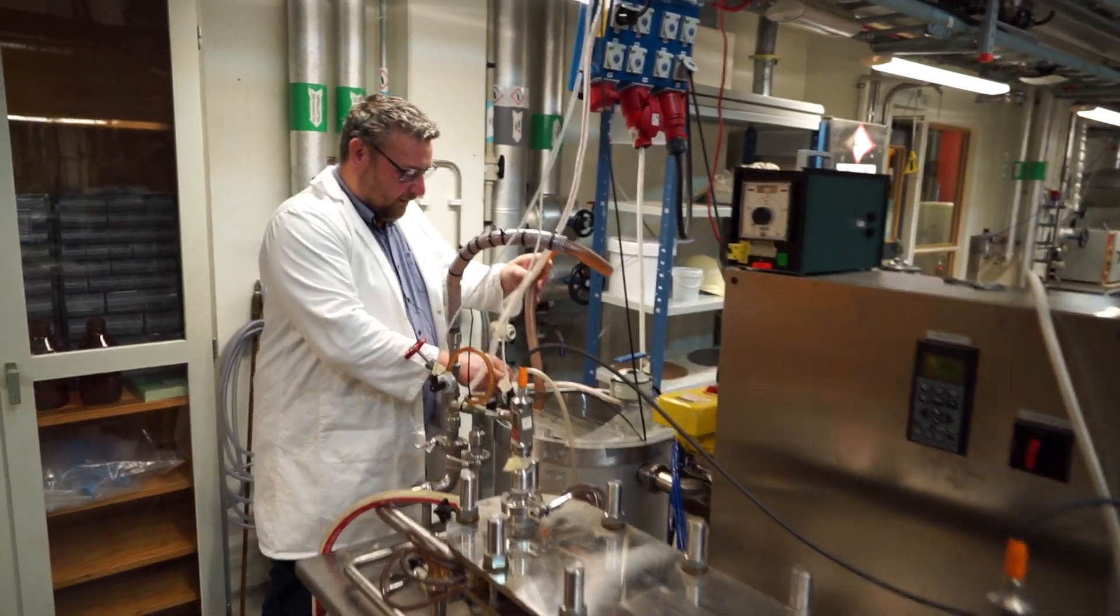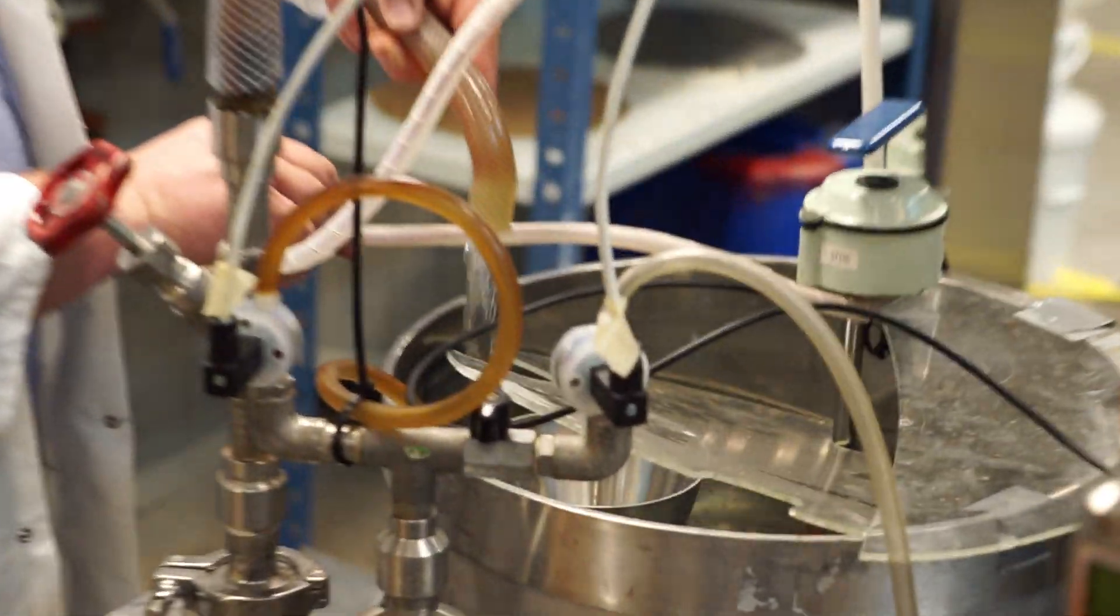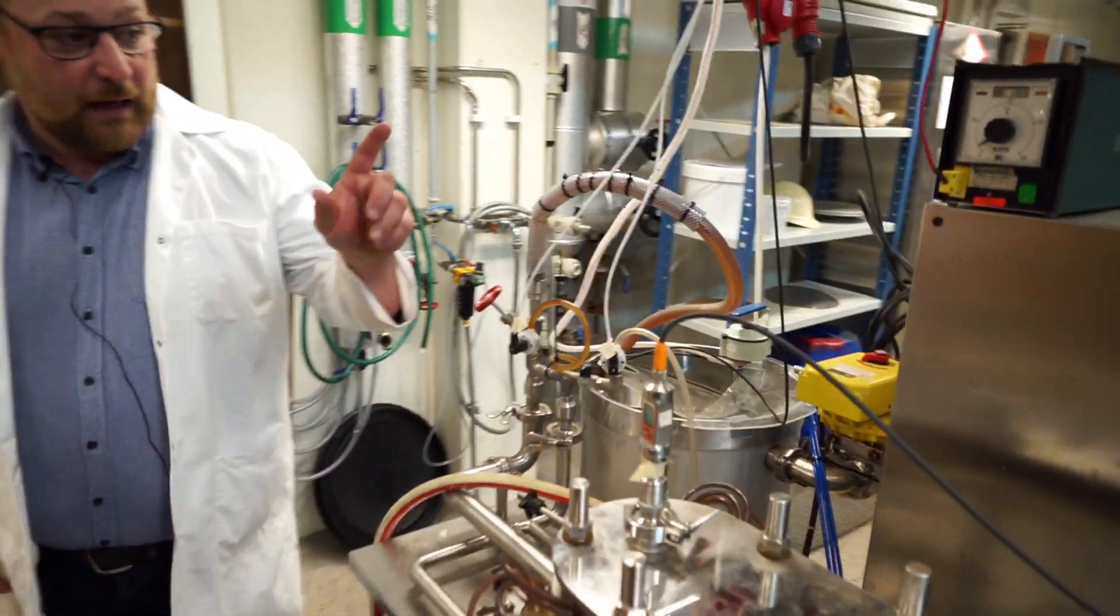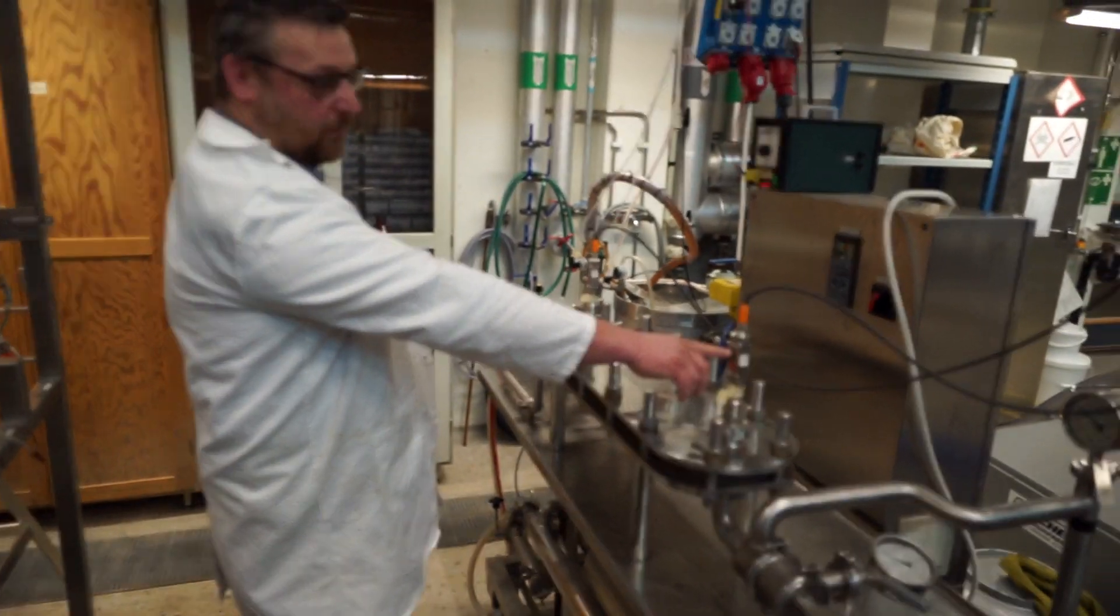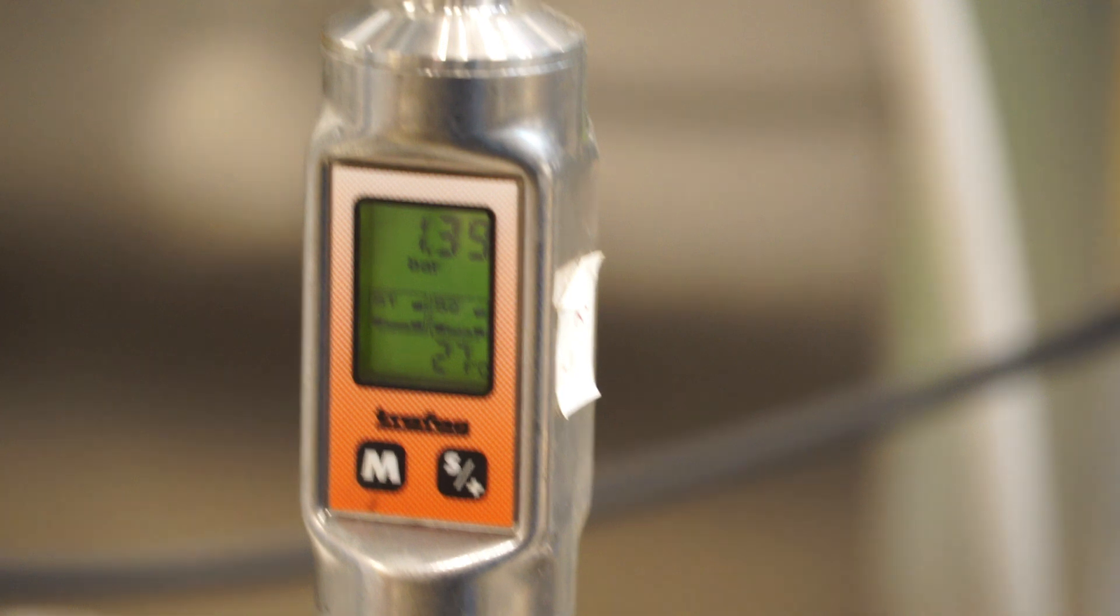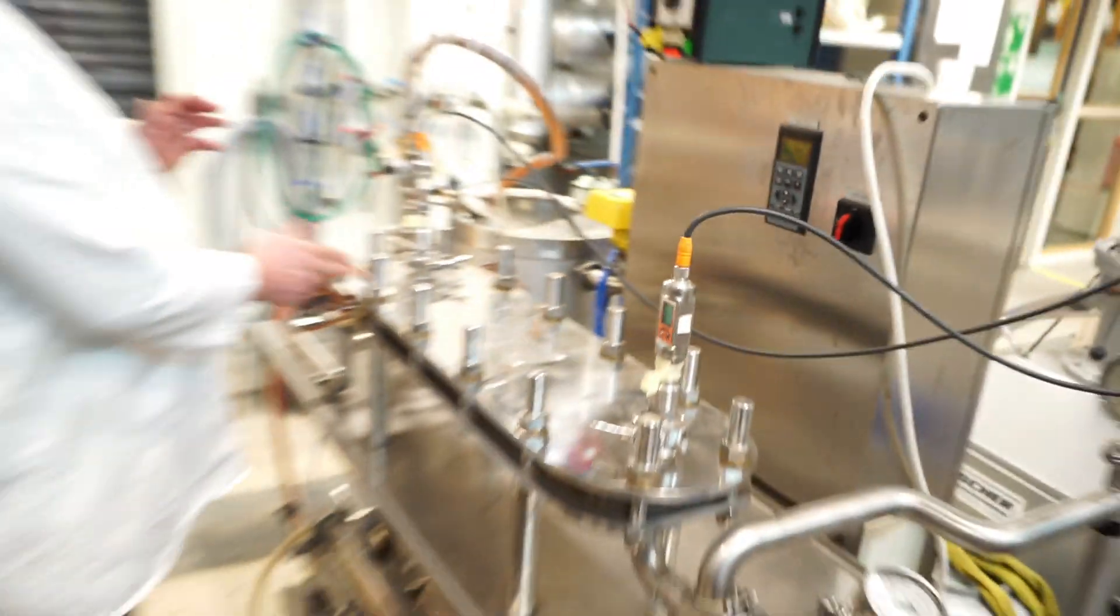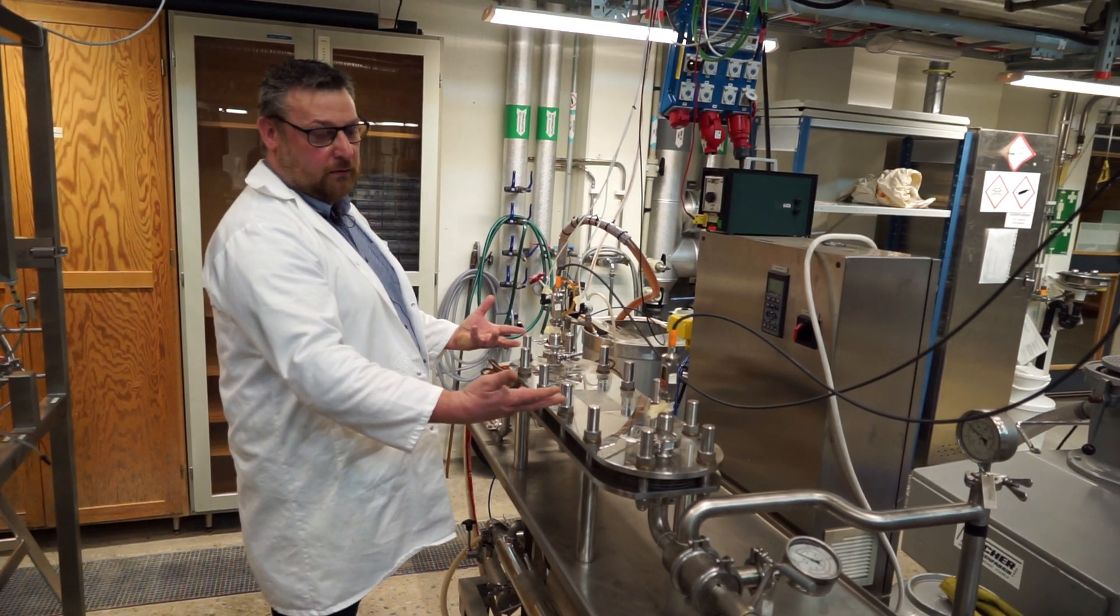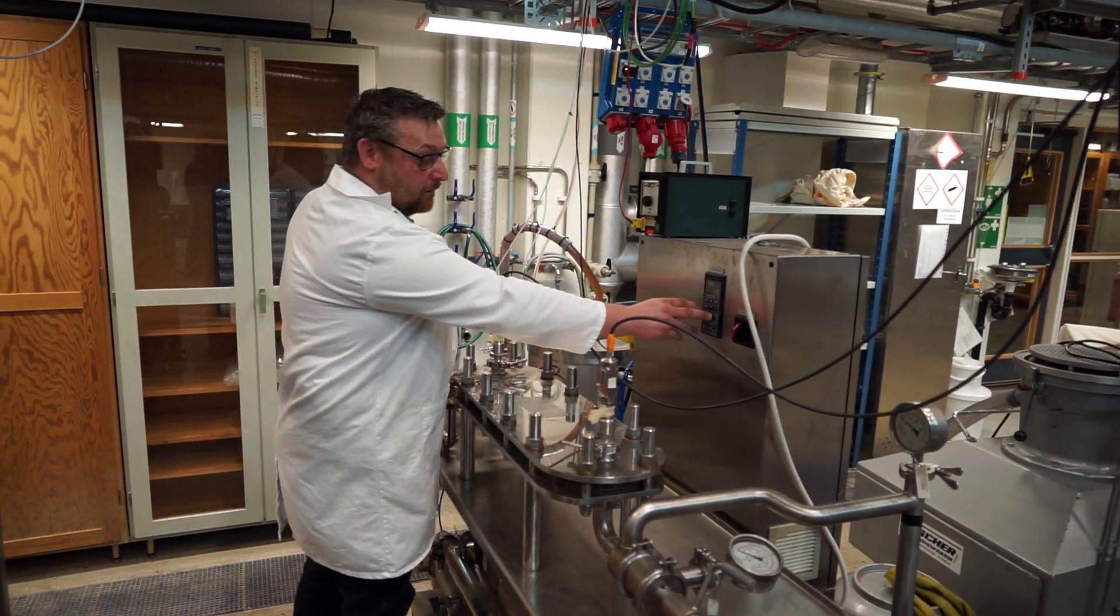That's a bit tricky, right? So, now you see the flow has gone up a bit. And I can hear the sound there as well. And at the same time as I was doing that, the pressure there was increasing. So, the inlet pressure now increased. In order to set the flow that I want across the membrane, and the pressure that I want as a transmembrane pressure, I need to work with both this valve and the pump speed.